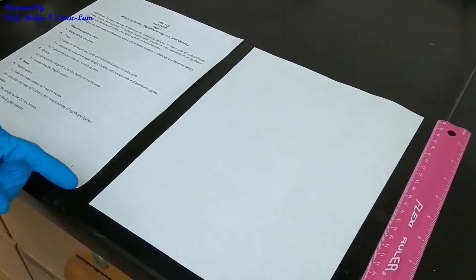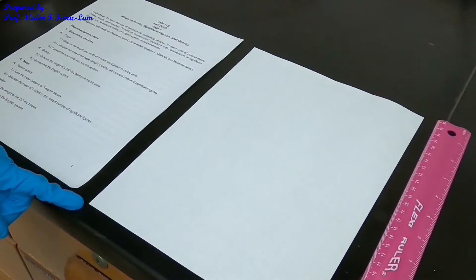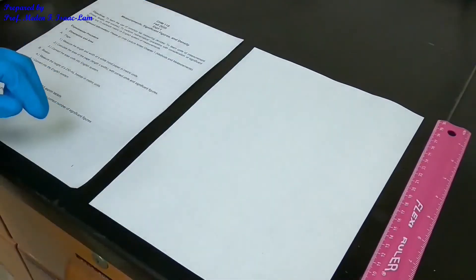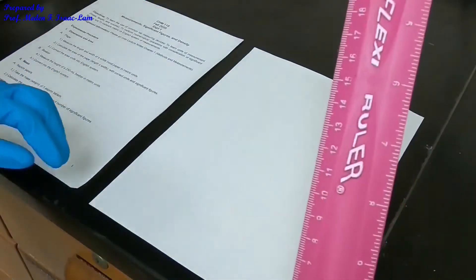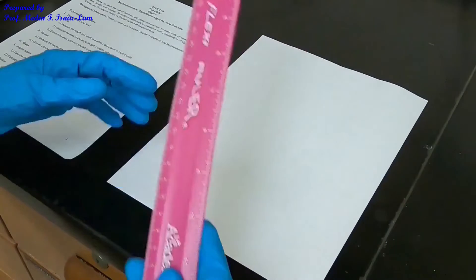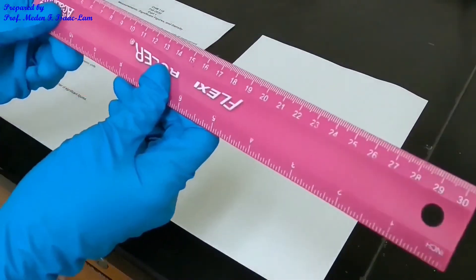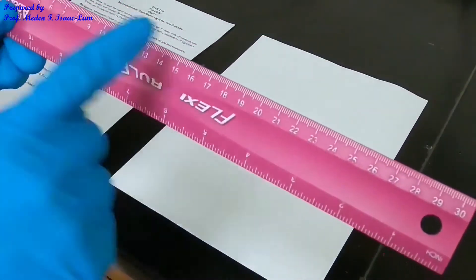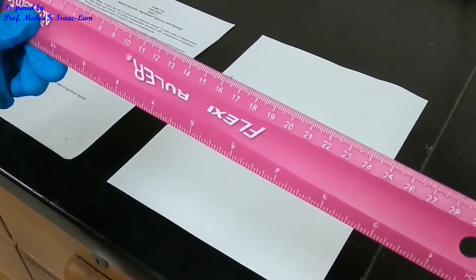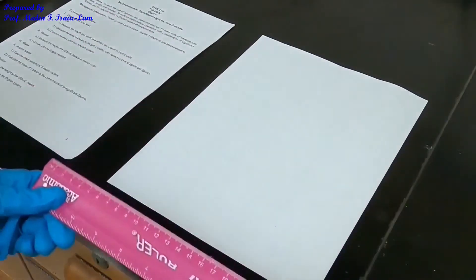We are going to measure the page — the width and the length. So we're going to use a ruler. I will be using the centimeter: one centimeter, two, three, four, and so forth.